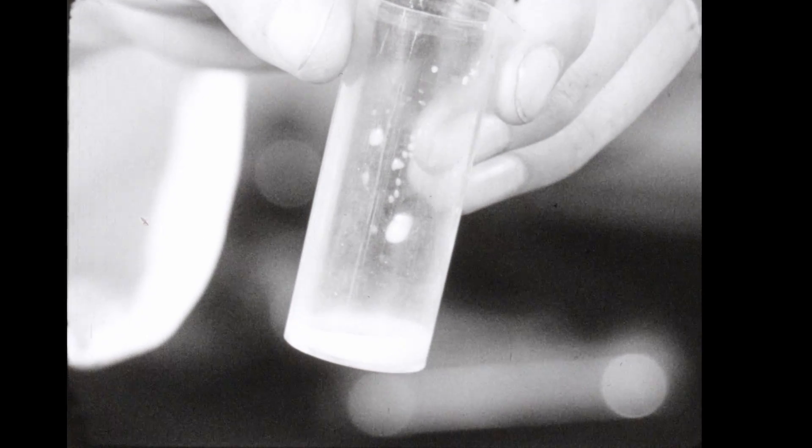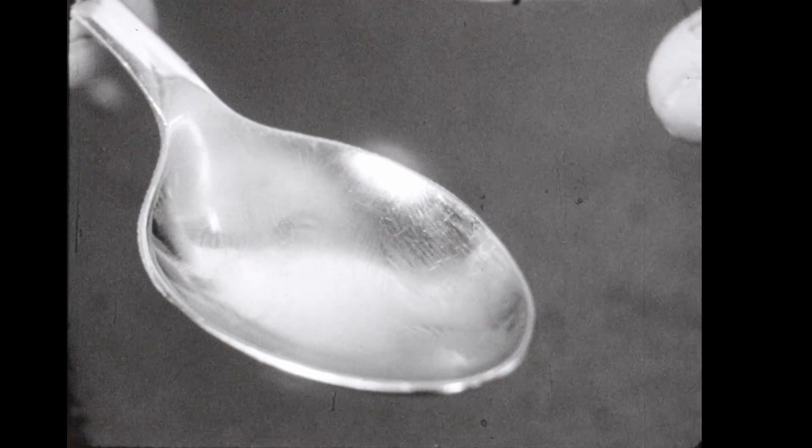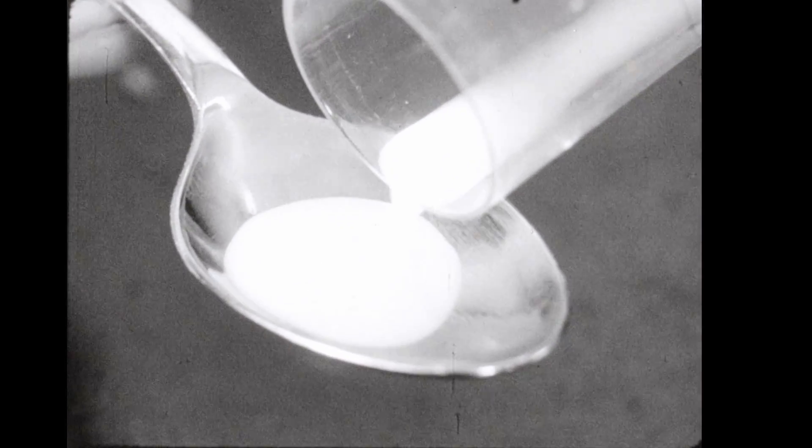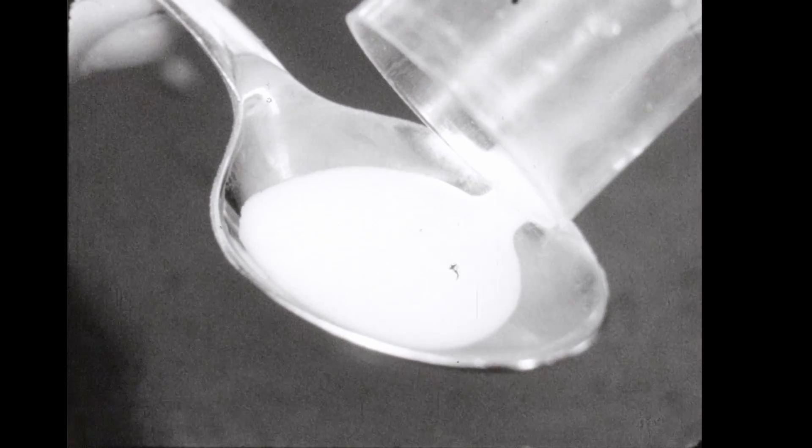Even with this milking machine, the throughput is only four mice per man hour. Not very fast by modern herringbone standards, but much better than the earlier single teat cup method which took one man hour per mouse.